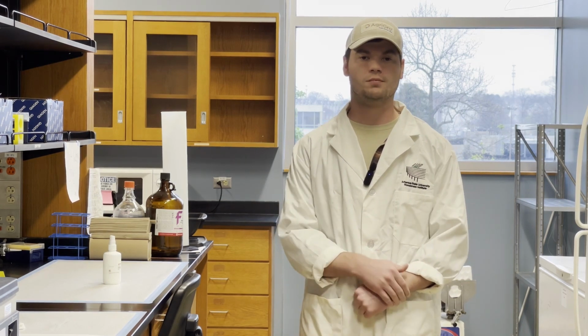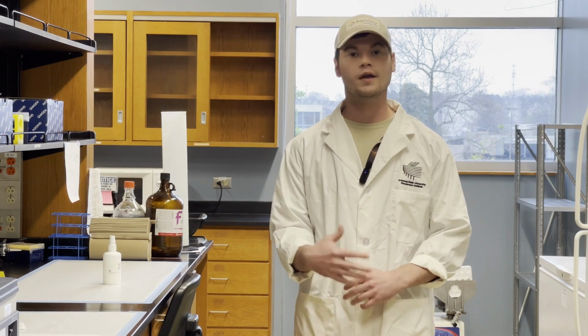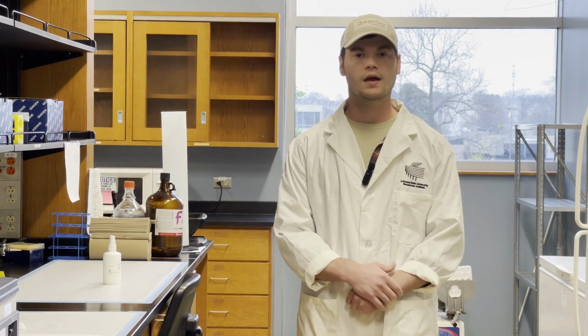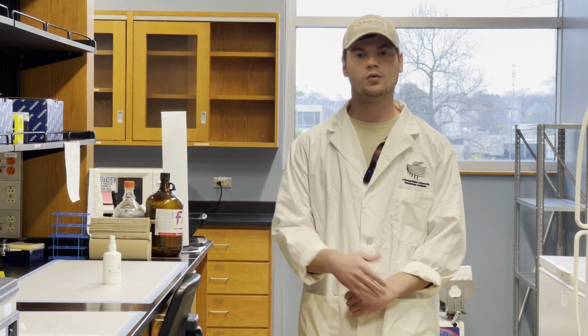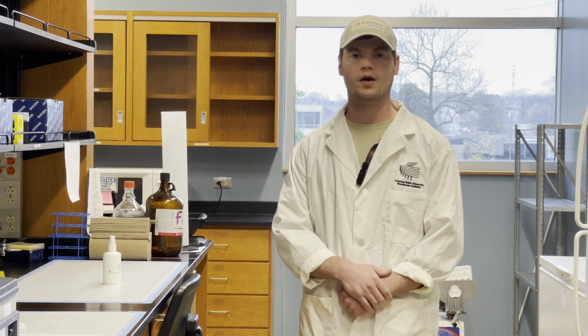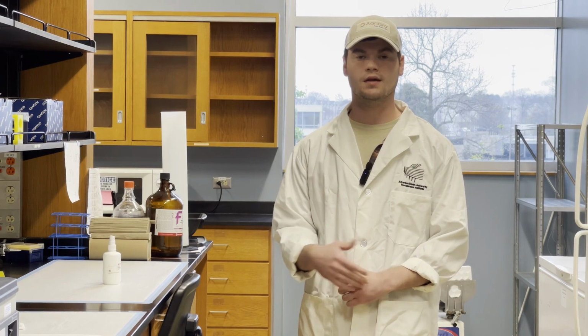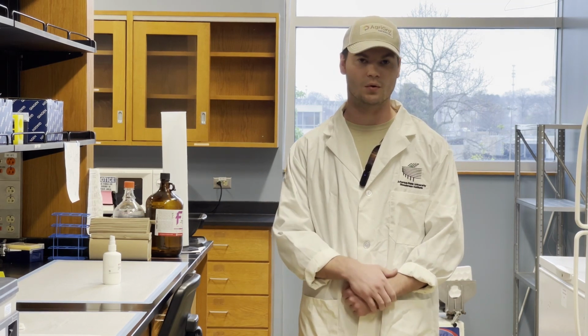We like to study interactions between soybean and Fusarium virguliforme to see if we can better understand what interactions are taking place and how they are influencing the native microbiome of the plant. In doing so, hopefully we can develop more environmentally benign methods to control the disease. So what we're doing today is trying to look at microbiome structure, and then function at a later time point, to understand how the pathogen suppresses the soybean rhizospheric microbiome, and how soybean plants that are tolerant and can fight off the pathogen have microbiomes that differ from those that are susceptible.